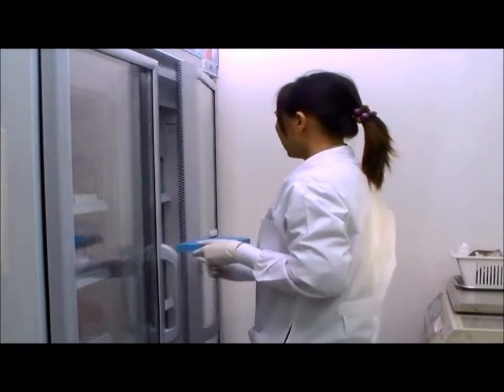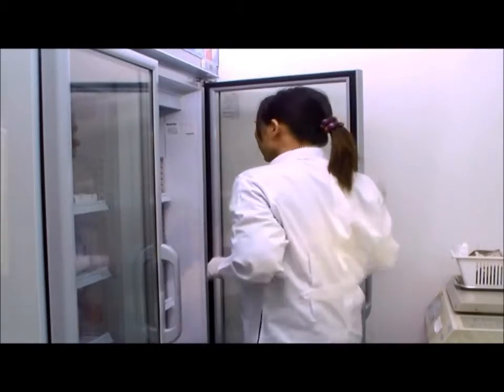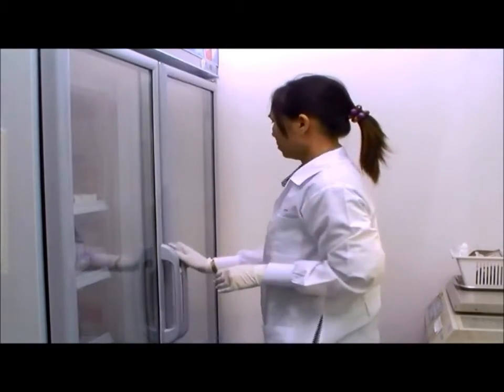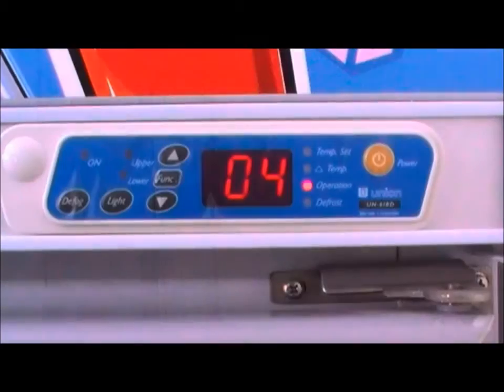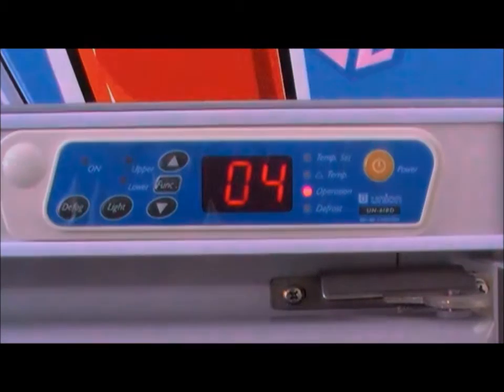Keep the cryovials overnight at minus 80 or minus 20 degrees centigrade before transferring to liquid nitrogen for longer term storage. If a freezer is not available, keep the cryovial at 4 degrees centigrade for 1 hour before transfer to liquid nitrogen.